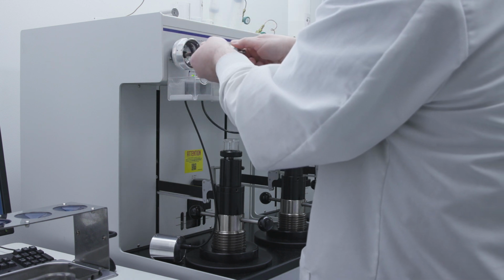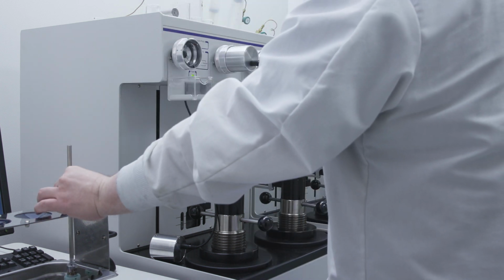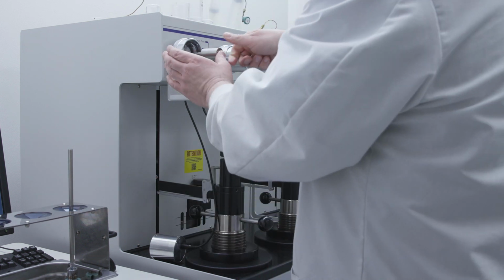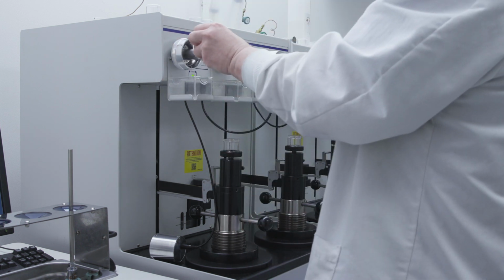Now Chris carefully slides the penetrometer from the low pressure port, being careful not to tip the penetrometer so that mercury doesn't pour from the end of the open stem. Since Chris is not starting another sample in the low pressure port right away, he will seal the port with a filler rod with a transparent retainer and a detector assembly in place.